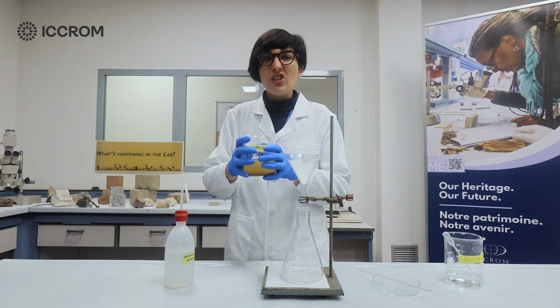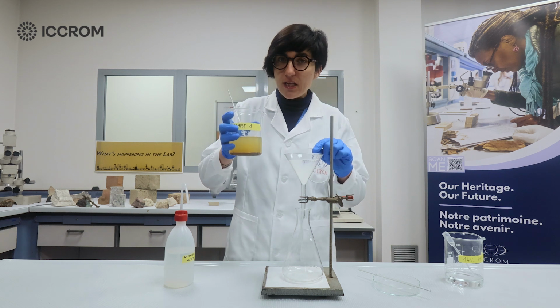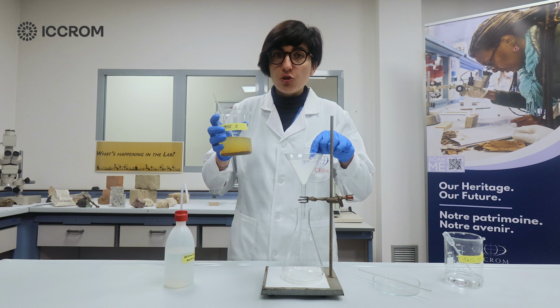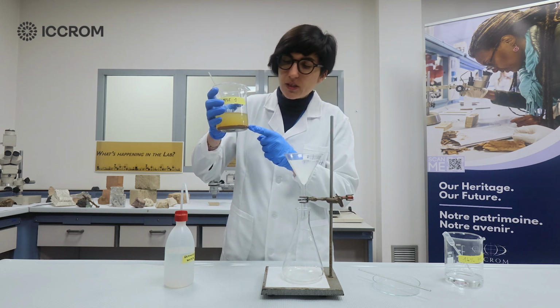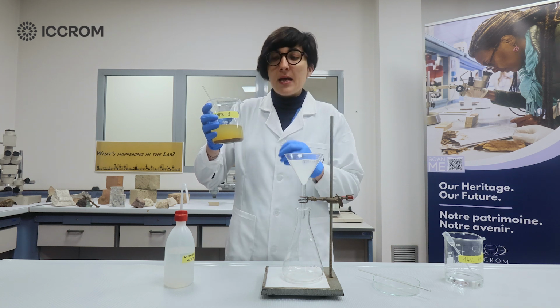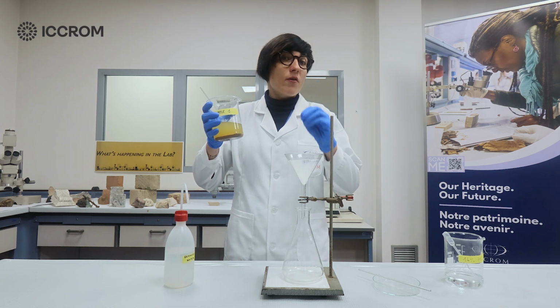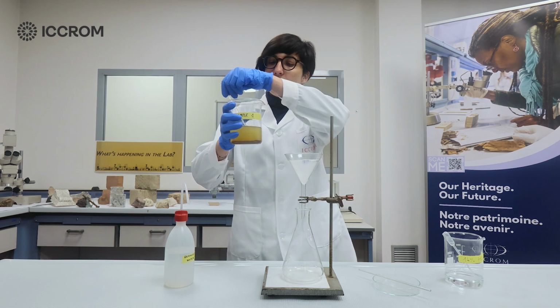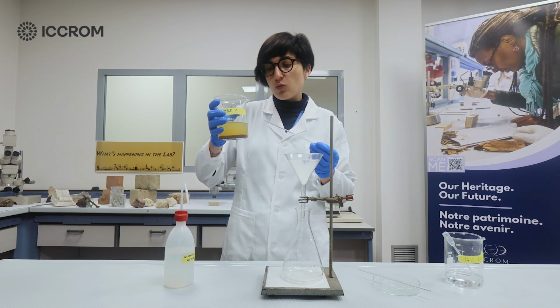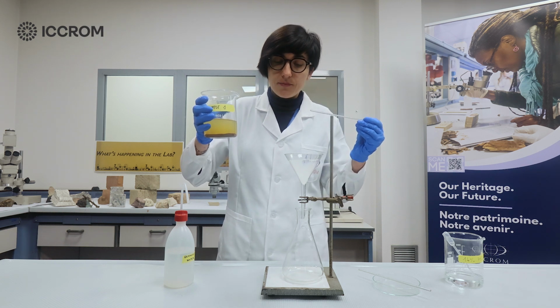When ready, you're going to very slowly, piano, carefully pour your sample into the funnel. Make sure to not break or tear the filter paper, and very important, make sure that no heavier particles fall into your funnel. Remember, the idea is that your filter paper will collect your fine particles. You're going to repeat these steps, adding a little bit of deionized water until you see that the water in your beaker is fully clear.